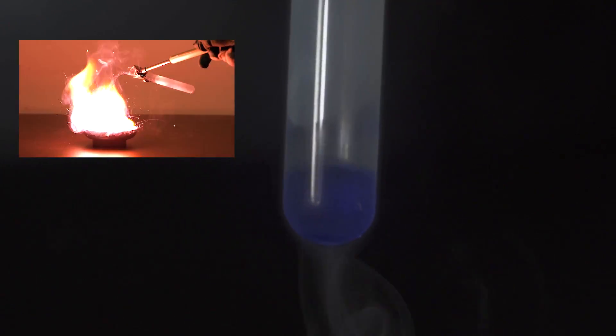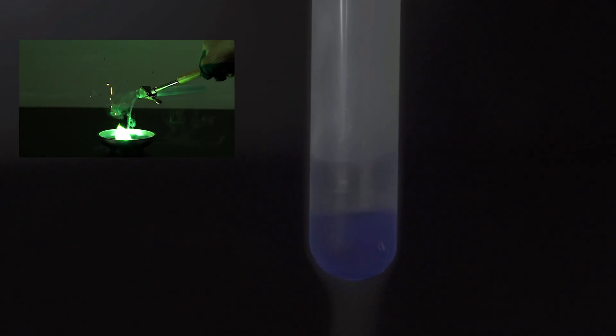Hey, guys! In one of my previous videos I showed you a few reactions with liquid oxygen and some burning borohydrides. Well, in this video I'll reconduct all these experiments, only this time I will be using liquid ozonated oxygen.